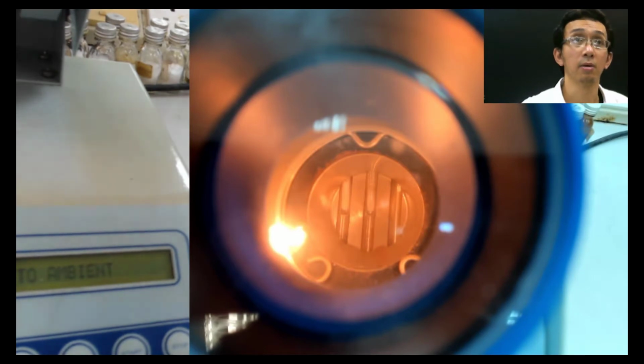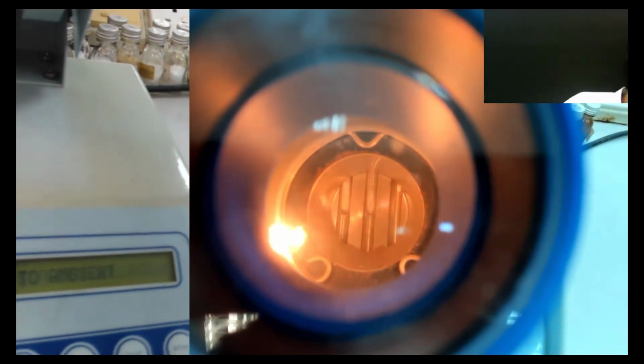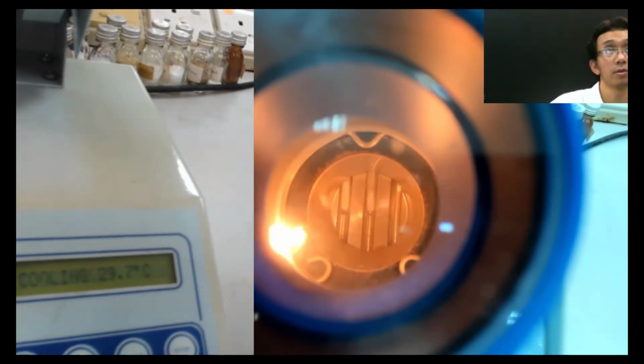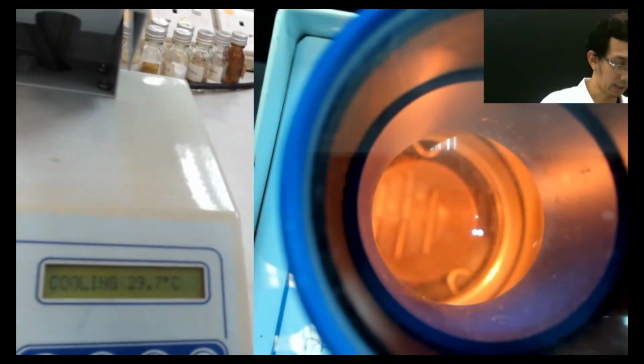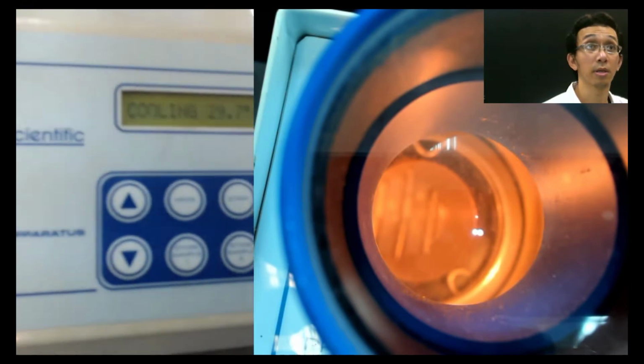Blurry. Blurry, yeah. So let me focus for a while. This thing I need to focus. Let me make it bigger. This one I make it bigger a little bit. Sorry, I have to do a little bit of control there. Okay, so I just here. Okay, that's the thing. So is it clear now, the number here?